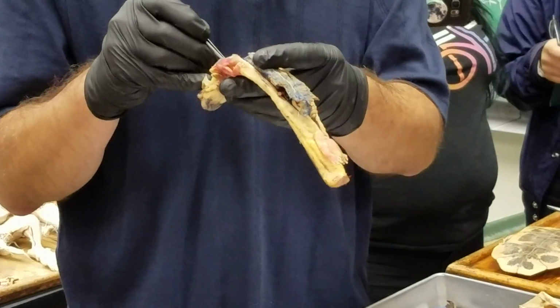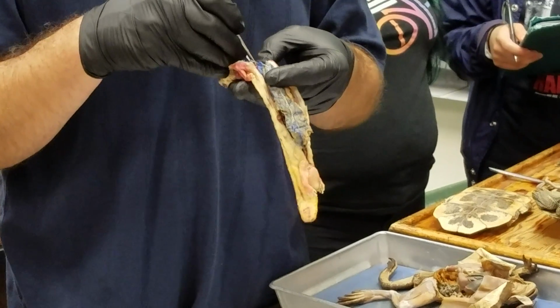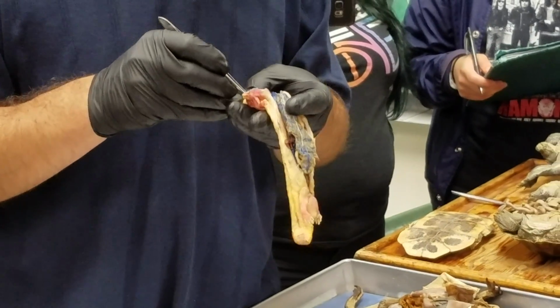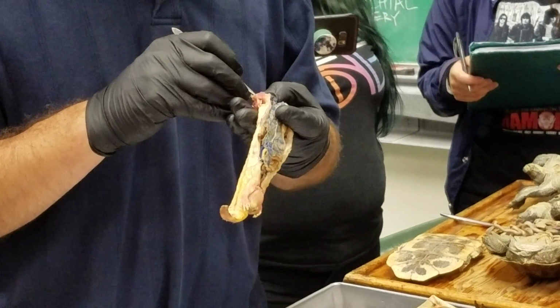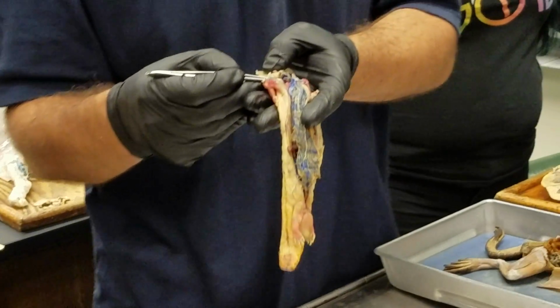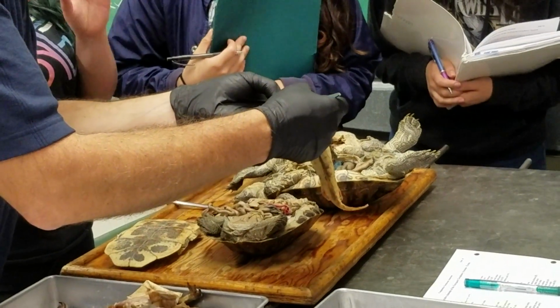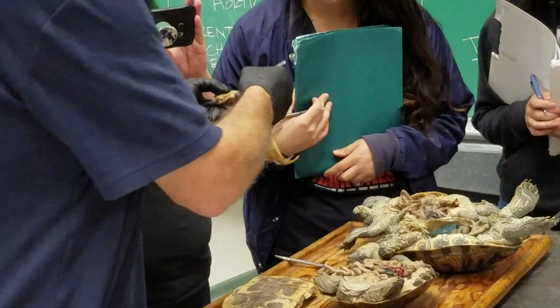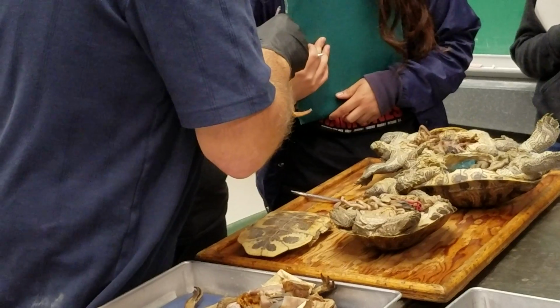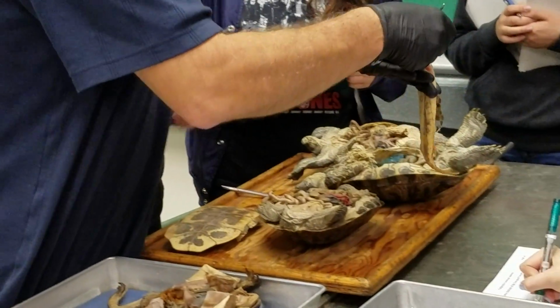Okay. And then the hepatic sinuses receive, coming in from the lateral side, the common cardinal vein. And that's really hard to find without destroying it, which most everyone did manage to do a good job of. But basically it came into this region here, and it's just kind of torn off on this side here, but it came in basically right about there, and then running forward from there is the sinus venosus. So the common cardinal comes in about there, and the sinus venosus runs forward. There and forward. You can see that over on this side. Connection right in there, and that's where this common cardinal is coming in. Okay. It's right in there.